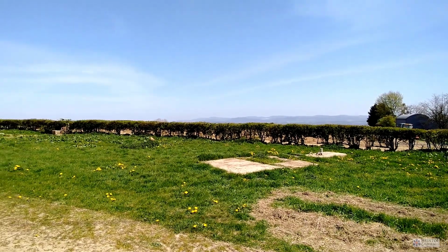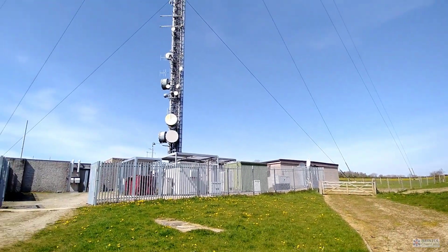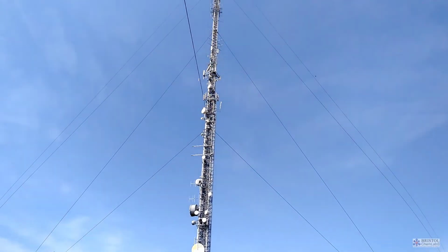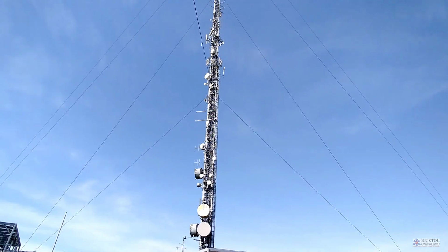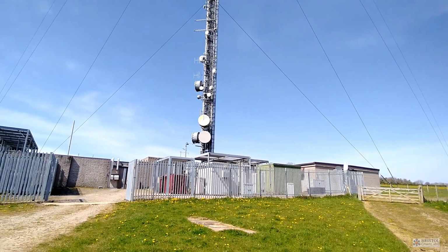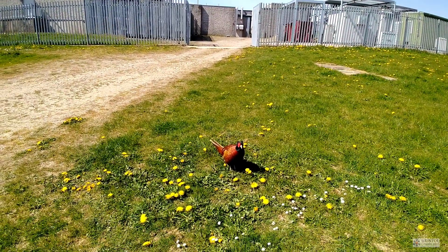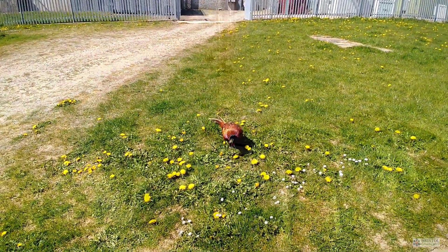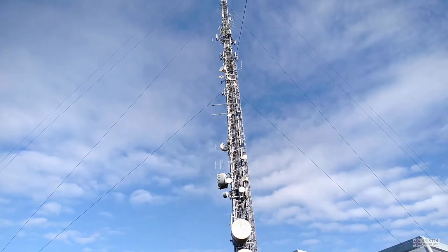Our sites in the UK are mostly located at telecommunication towers, broadcasting towers, because we quite like to measure the air not right at ground level, but a little bit higher up. That is mostly because at ground level you have a lot of emissions. You could have carbon dioxide from cars, or methane from cows.